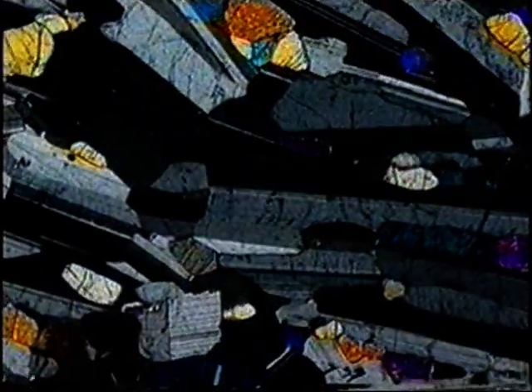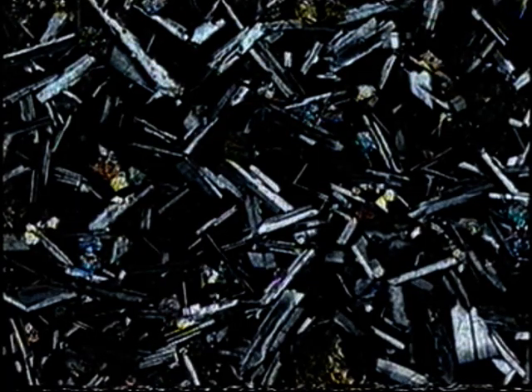Unlike albite, calcic plagioclase typically has broad, well-developed albite twins, making it easy to identify. Other properties are typical of feldspars. Plagioclase in igneous rocks typically occurs in these elongate laths, particularly in volcanic rocks.